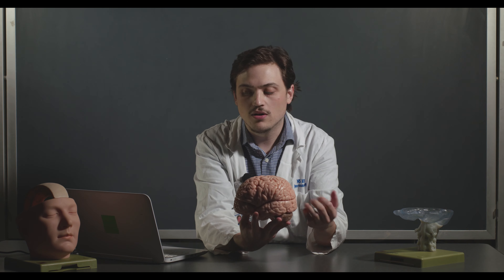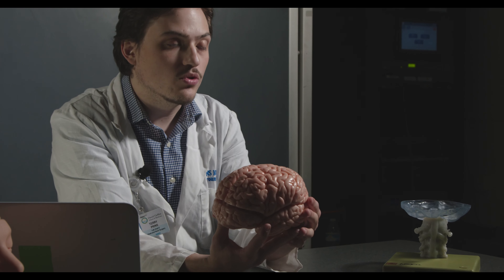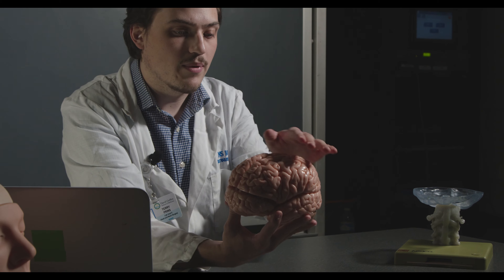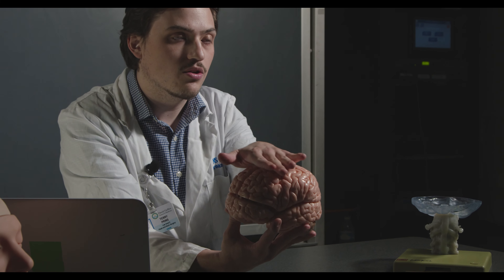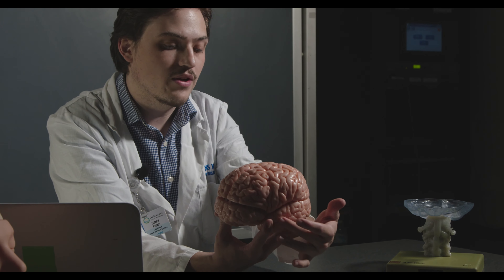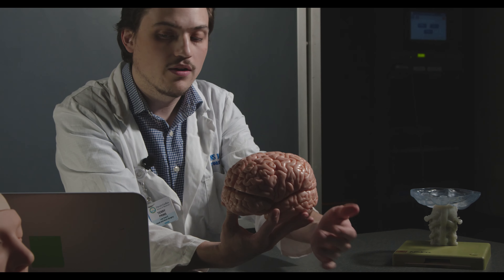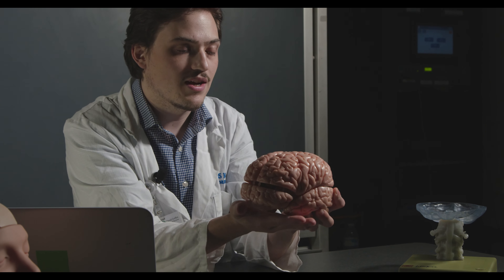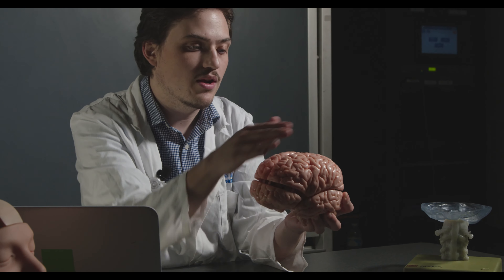The common terms you'll hear a lot are lateral, medial, dorsal — or sometimes superior — and then ventral or inferior. Dorsal or superior just means on top. So structures closer to the top surface of the brain are dorsal to structures found lower down. Ventral or inferior refers to structures closer to the bottom side of the brain.